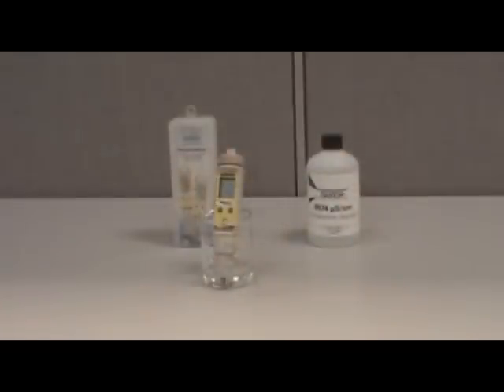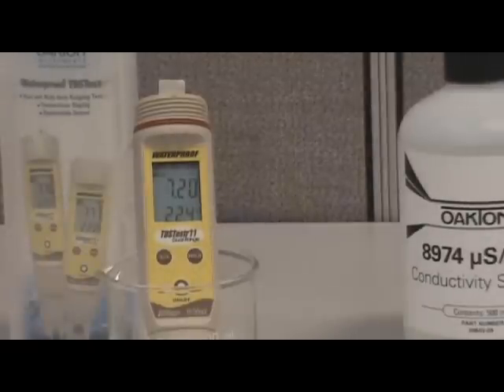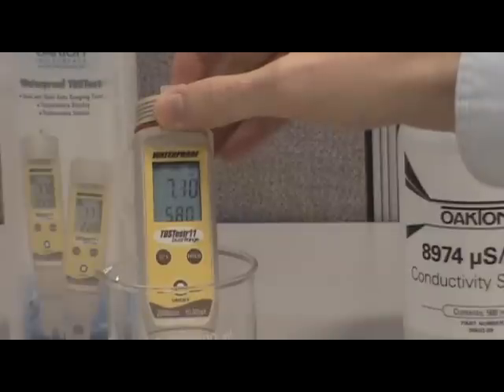Place the tester in a beaker containing enough calibration standard to completely cover the two metal pins, and then turn on the tester. Next, press either the increase or decrease control buttons to enter calibration mode. Cal 1 point will be displayed on the screen. Adjust the value using the increase or decrease button until it matches the value of your standard. In our example, it should read 7.60 parts per thousand.